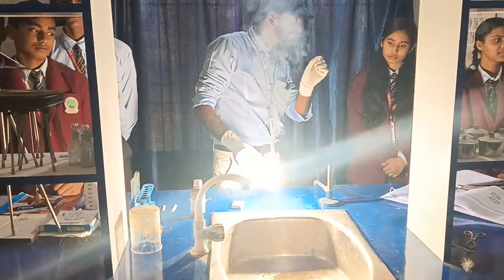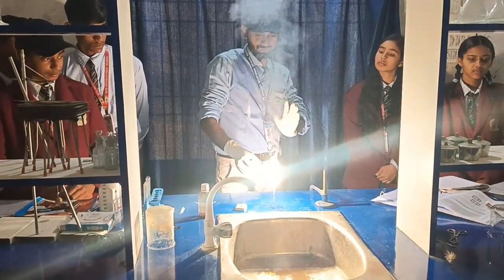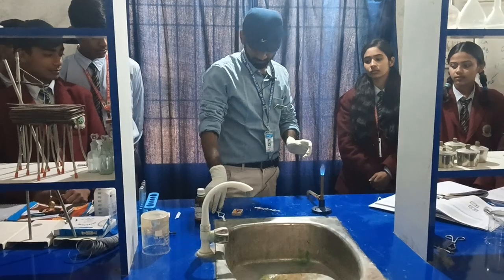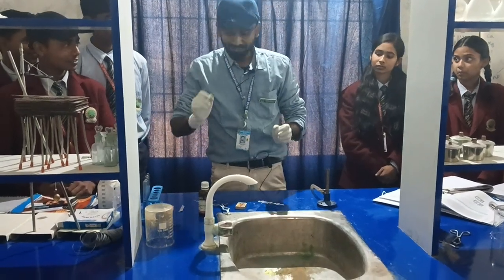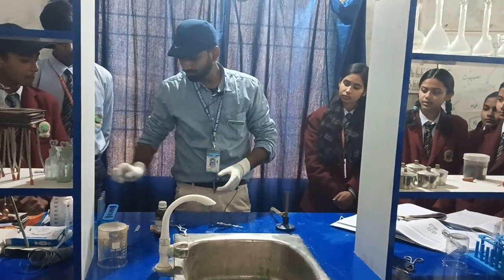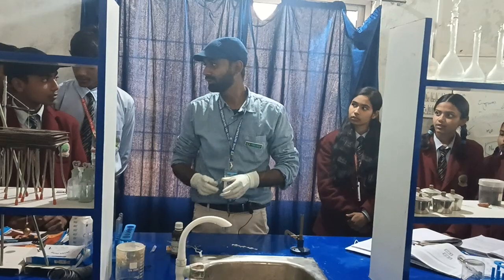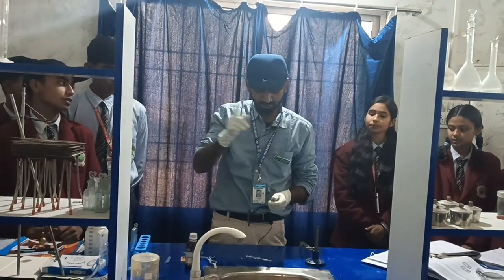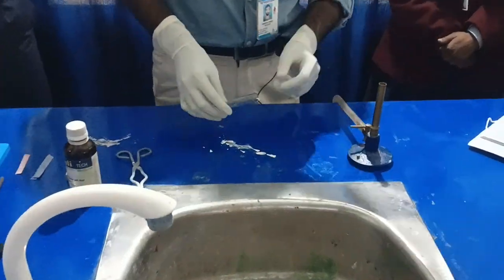The temperature at which it burns is very high. The ash we have is magnesium oxide. The formula for magnesium oxide is MgO — not MgO₂ — because the valency of both magnesium and oxygen is 2, and they cross-cancel to give MgO. The color of the ash is white.